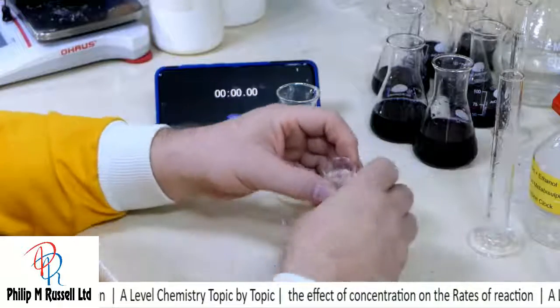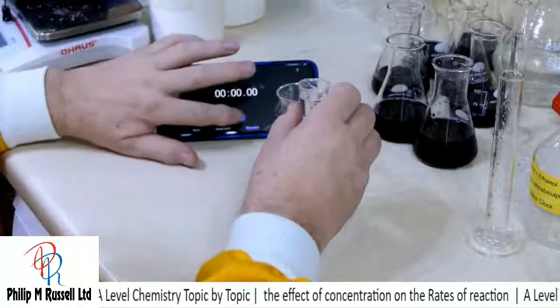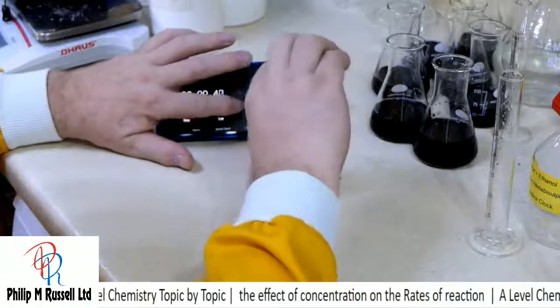I rejected that beaker because I'd already got a little bit of iodine on it. So let's start the experiment.